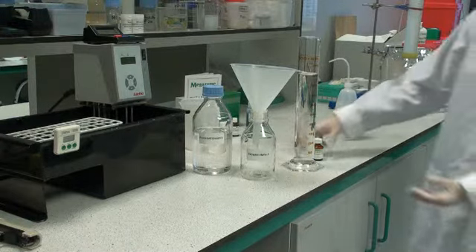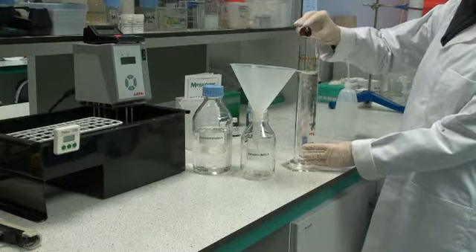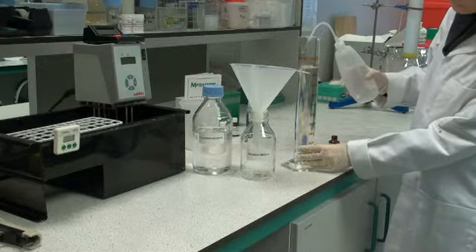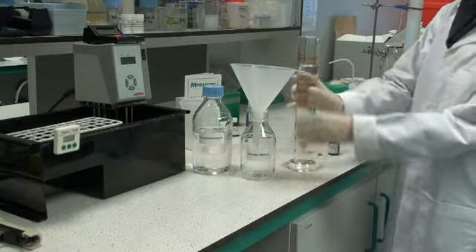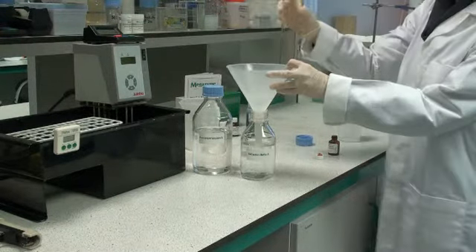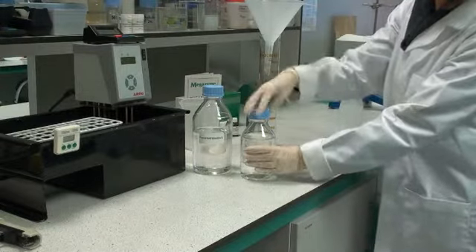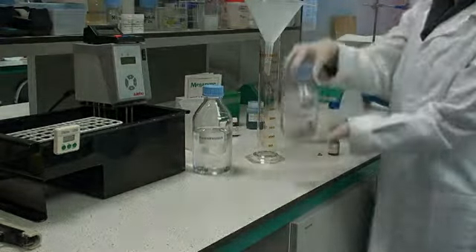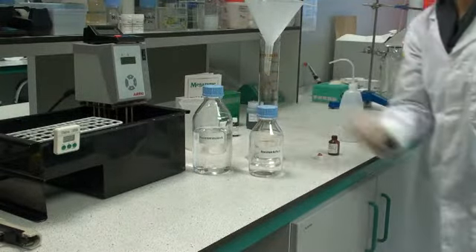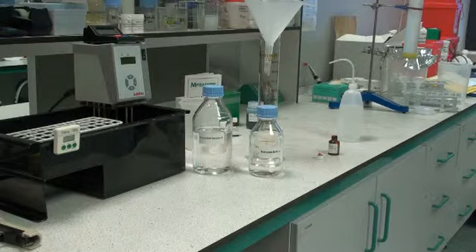Extractant buffer solution A is prepared by diluting one vial of concentrated buffer A, 25 ml, to 500 ml with distilled water. This solution is made up to volume in a measuring cylinder, then transferred to a Duran bottle. This is then mixed well and capped before use. This should be stored at approximately 5 degrees centigrade between use. If you need to prepare more of this extraction buffer or the concentrated form, a recipe is given in page 3 of the information booklet.